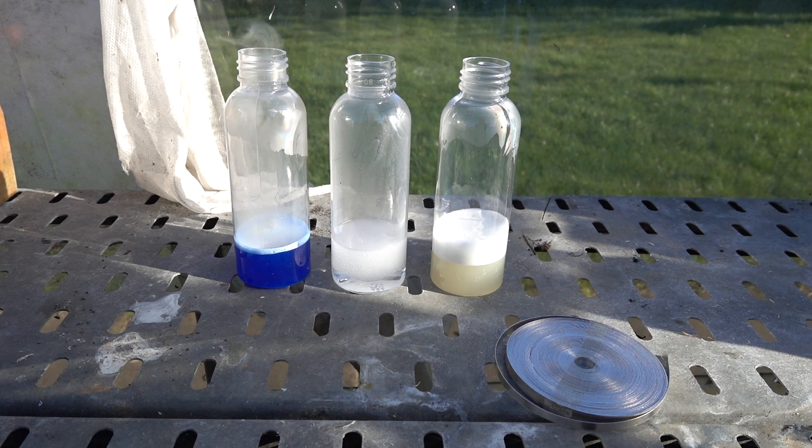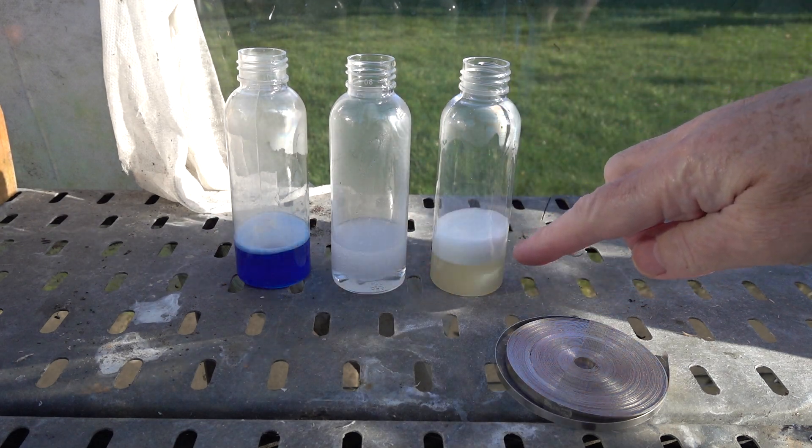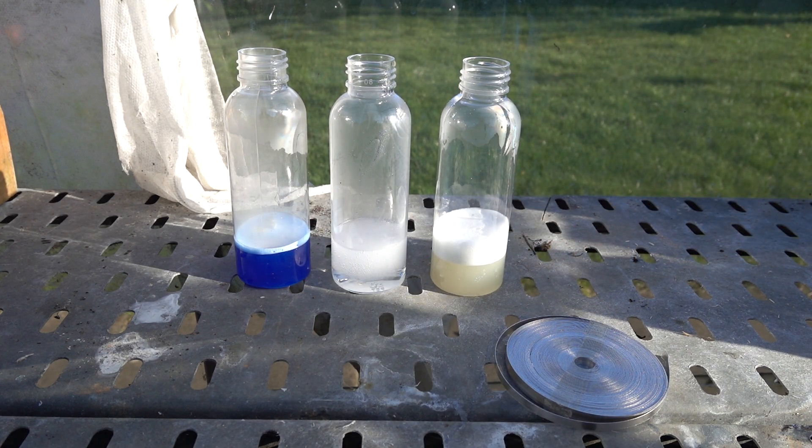So that's magnesium with three different acids — hydrochloric acid, ethanoic acid, and citric acid — and testing the gas produced in each case. Positive test with a lighted splint: the gas burns with a pop. Proof that that gas is hydrogen.